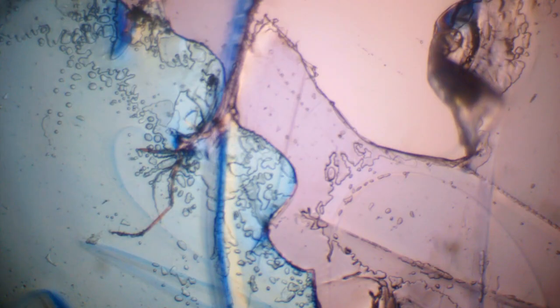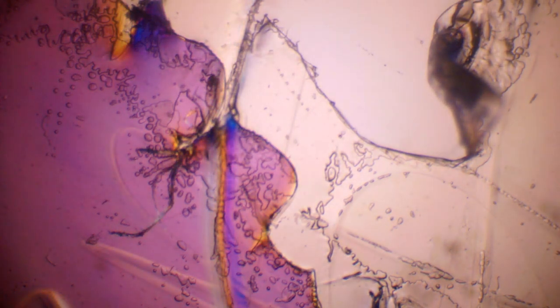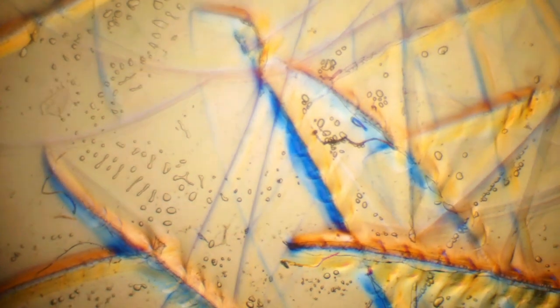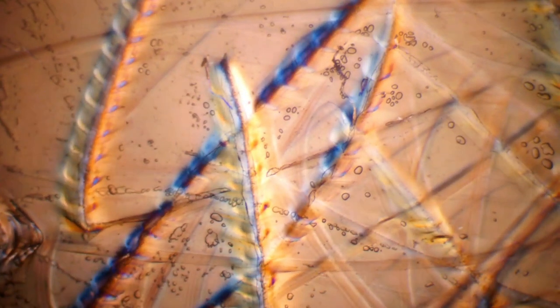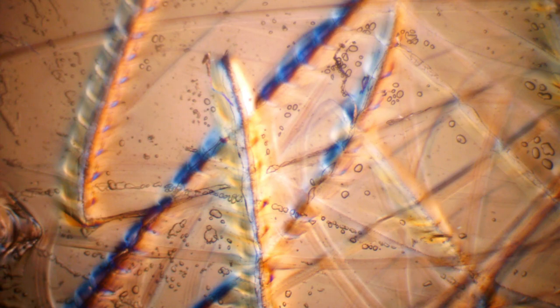This is how it looks like in polarized light. I can rotate the stage and you see how the colors are changing. That is the whole purpose of a rotating stage, so you can test out different angles of polarized light. You can also try to change the rotation of the filter in the objective. Now you see the colors also change. I'm changing the orientation of the analyzer which I put into the objective. At least with sticky tape, the color changes are quite notable and can be seen quite well.